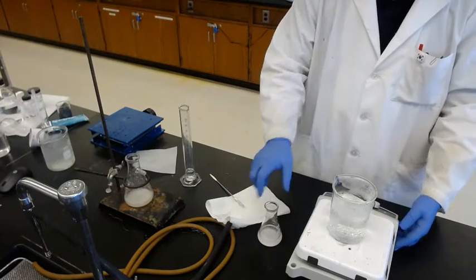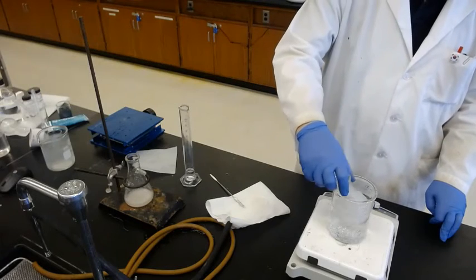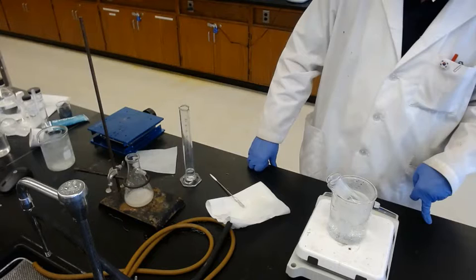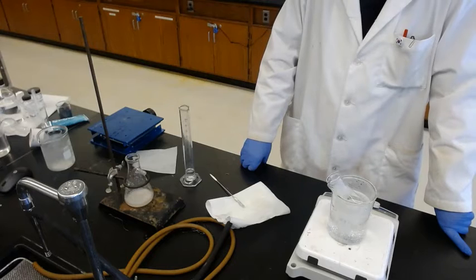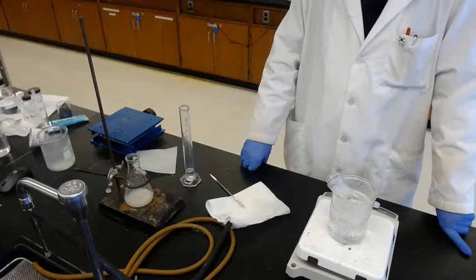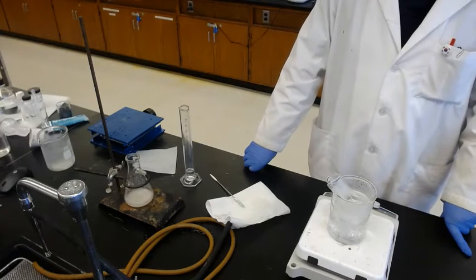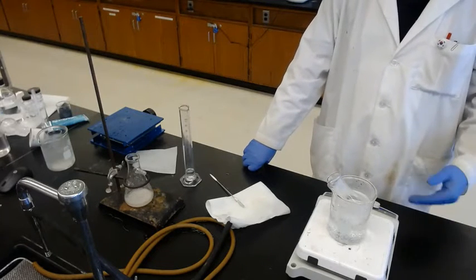It's a good habit to prepare the next step material ahead so we can save time. Okay, put it inside, and wait until it's boiling. And ethanol is flammable, so you cannot heat the ethanol directly on the hot plate, because if the ethanol vapors touch the hot plate, which is hot, it makes fire. So whenever you're heating organic solvents or flammable solvents, use hot water, so indirectly heating. Only water you can heat directly on a hot plate.